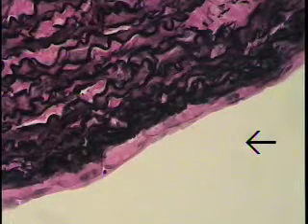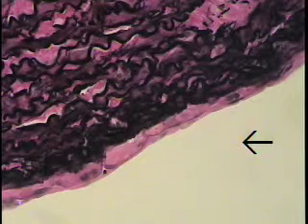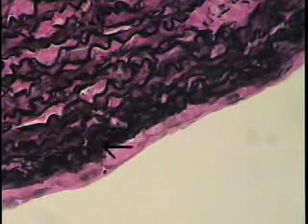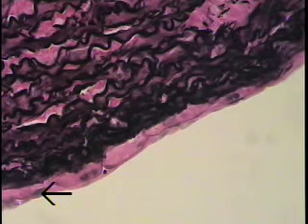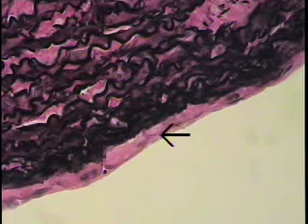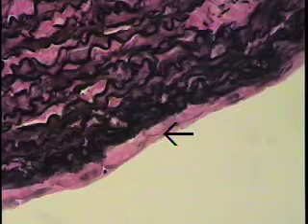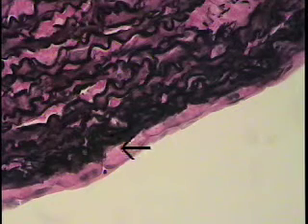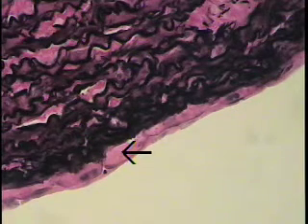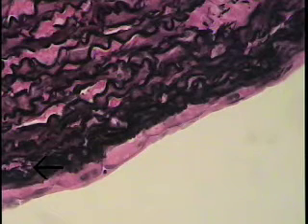This is slide number 22, again of aorta, but this preparation has been stained specifically to demonstrate elastin. What we can see is the intima at this location, the endothelial nuclei shown at the tip of the pointer, and the thin cytoplasmic extent of these endothelial cells between the nuclei. So this is the endothelial lining. This light pink material is the subendothelial connective tissue. This huge dense band where the arrow disappears is the internal elastic lamina.